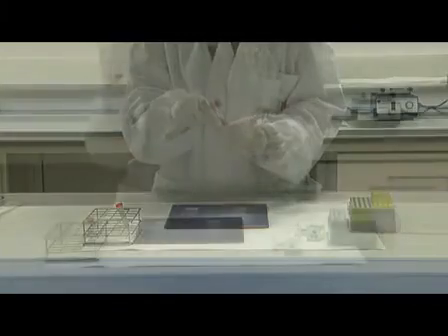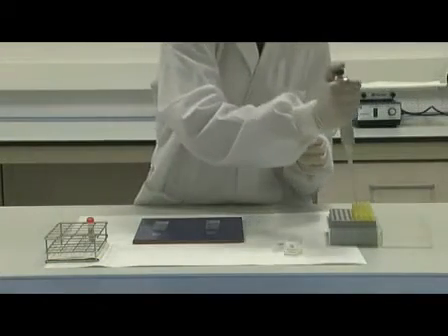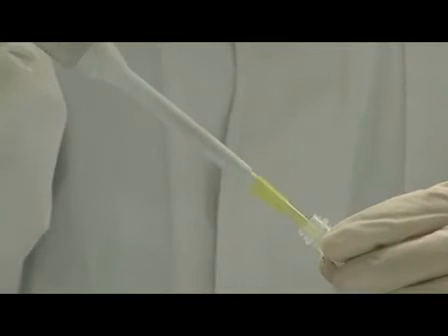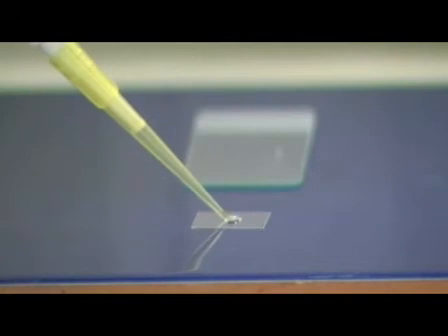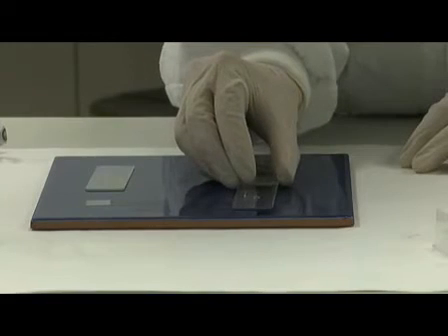Both probe mixtures are pre-denatured in a hybridization buffer for easy use, so you can add them directly to the decondensed and denatured slides. There are also other commercial probes available for a wide range of chromosomes and loci that can be used in these experiments.